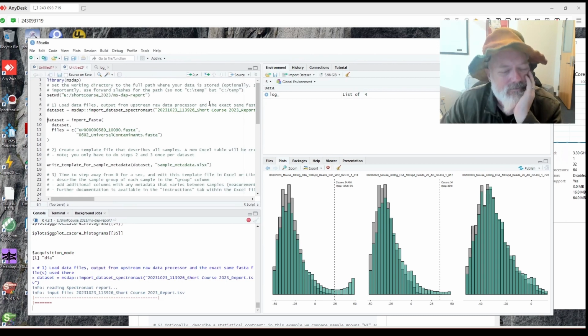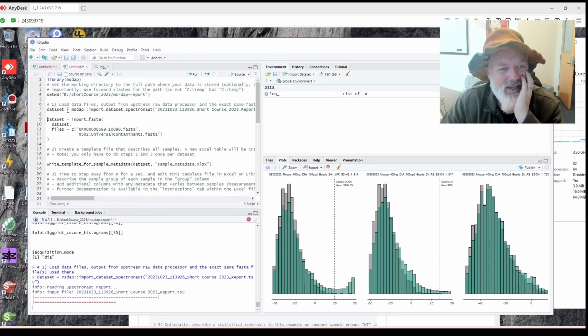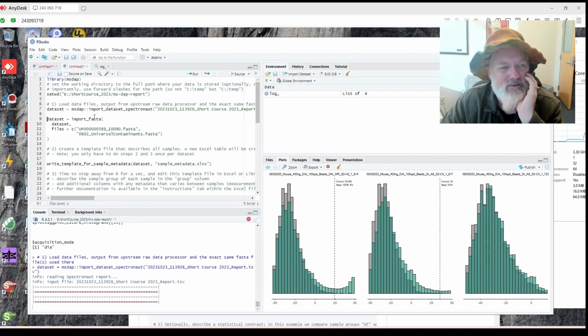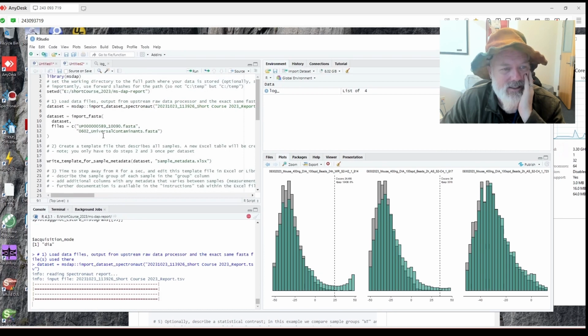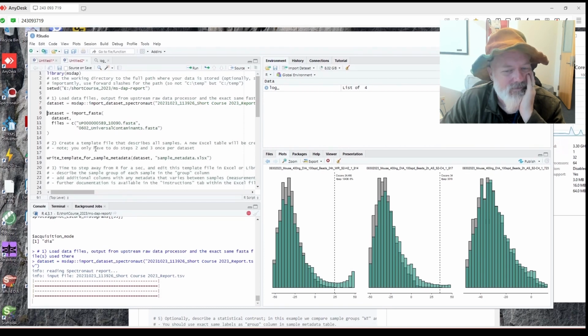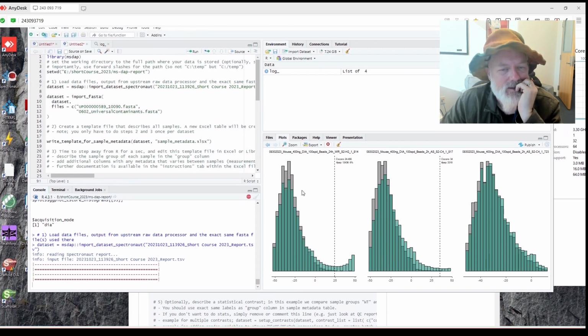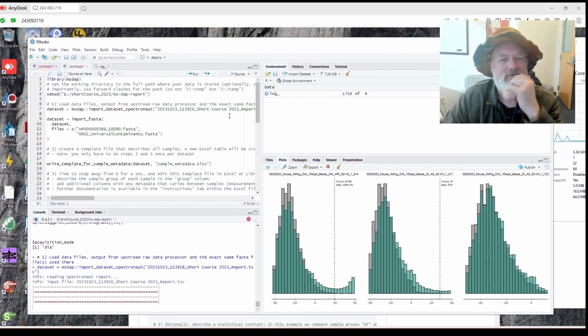So let's do that, and it basically imported it, but I didn't tell it where to save it because I copied the line and I forgot to put dataset equals. I don't like equals. I like using the little arrows, but that's okay. That was dumb on my part. But if you have that error, that's why. So let's see. It's kind of cool. It shows this though. Only take another minute, and you should see a data set here.